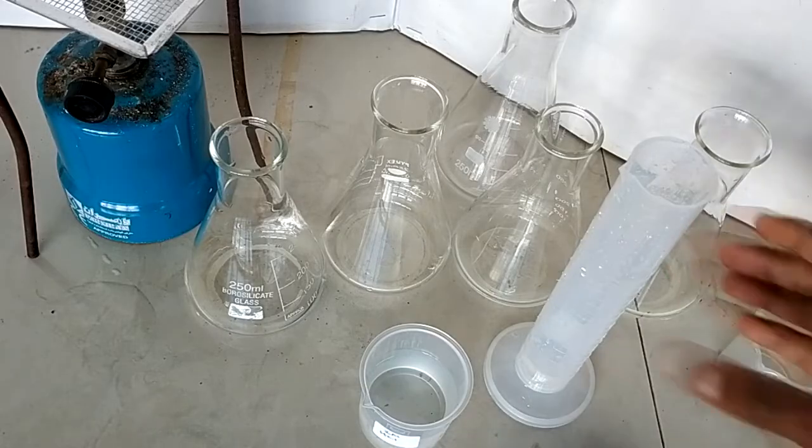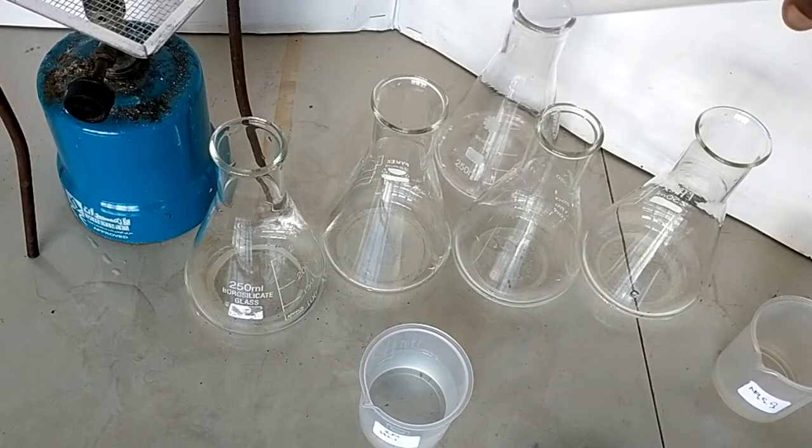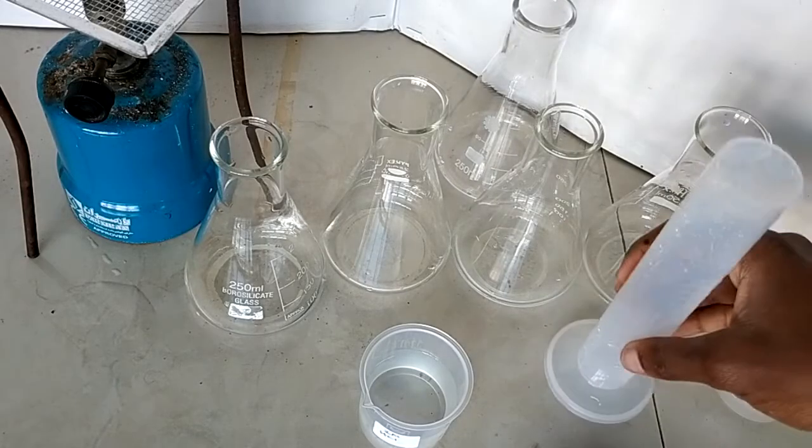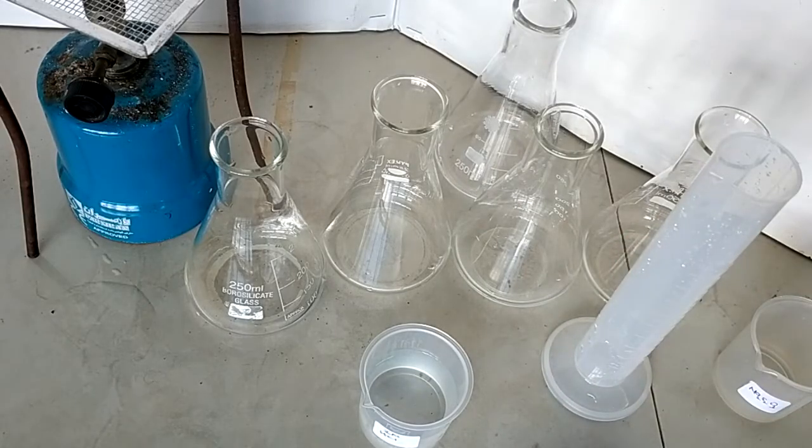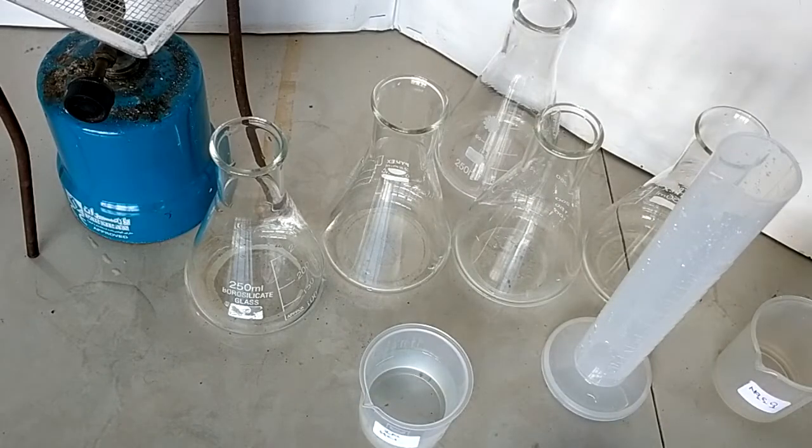I have five conical flasks filled with 30 cubic centimeters of sodium thiosulfate. The next thing is to measure the steady temperature. So I want to measure the steady temperature of one of the solutions in the flask.